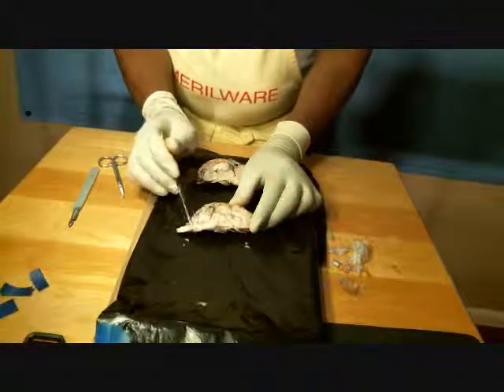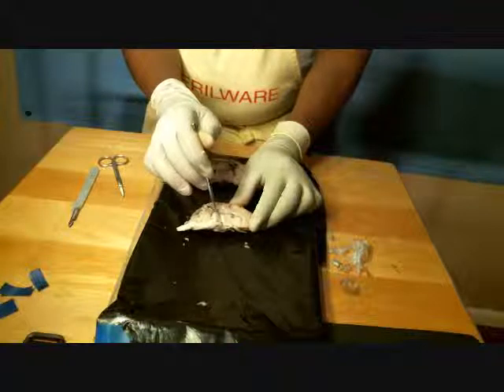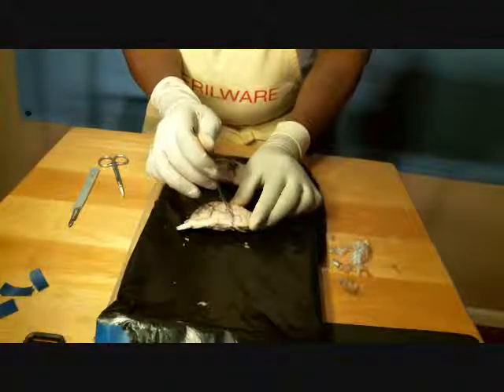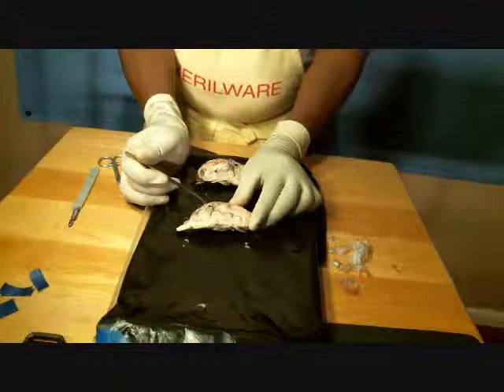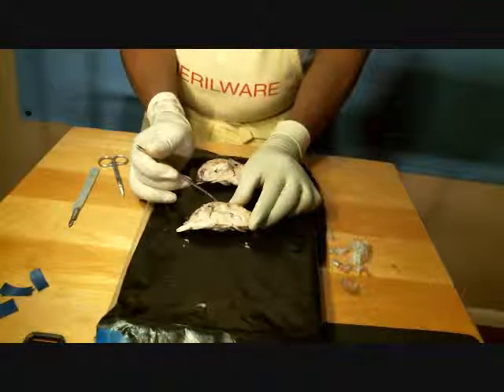Here's my medulla oblongata here, my pons here, my cerebral peduncle here. The hypothalamus, I believe, is just about here in this section over there. I know I've missed a few of them, but I'd be lying if I told you I could identify the structures any further than what I've done.